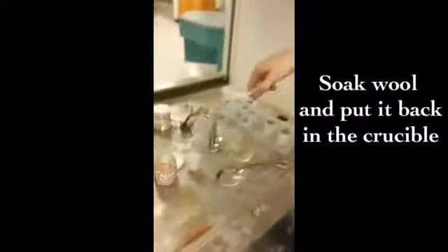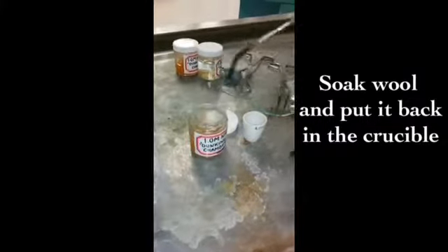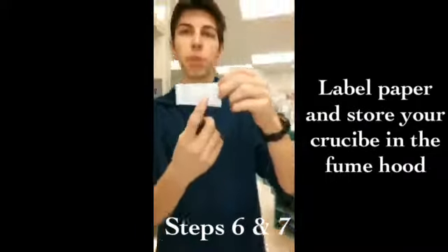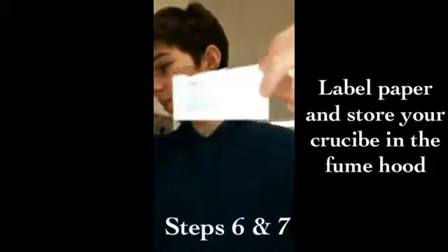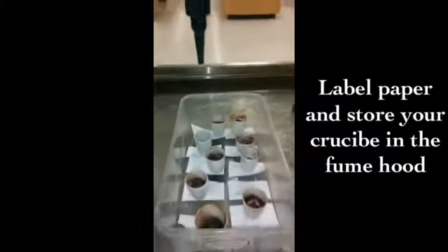Now that we're done with steps 1 through 4, let's do step 5. I'm going to take my steel wool, dunk it in the ammonium chloride, let it soak, and put it back in the crucible. And step 7, take a piece of paper and put your block, class, and names. And lastly, take your crucible and put it right on top of the paper. Now the waiting begins.